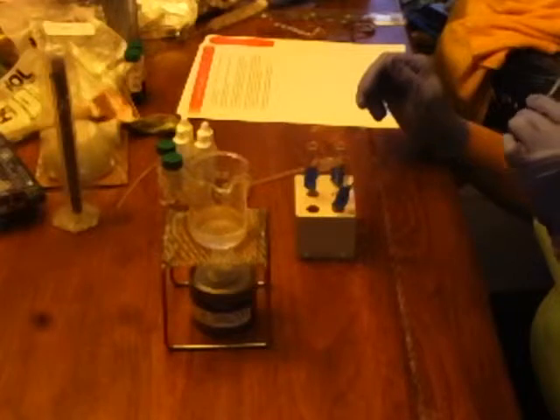And this is number 6. Again, it's a really sweet smell, kind of fruity. Not quite sure what that smell is.